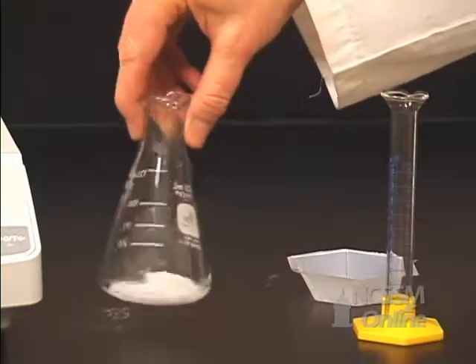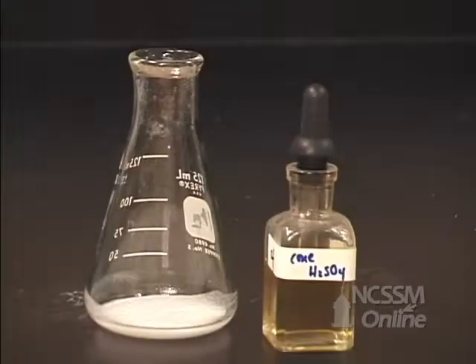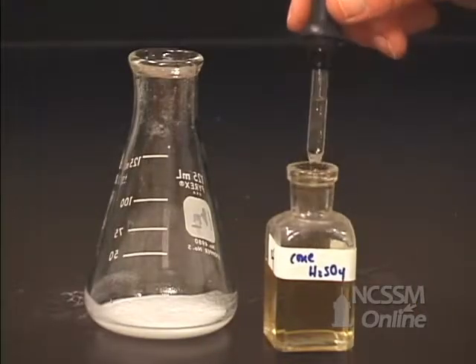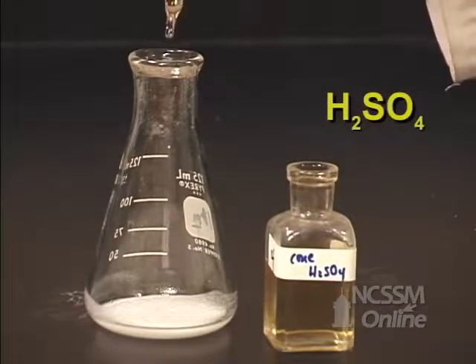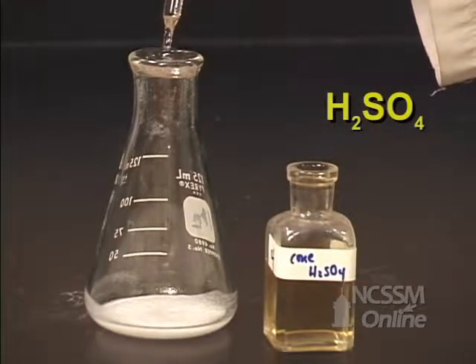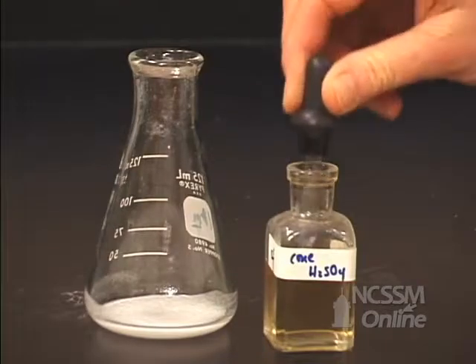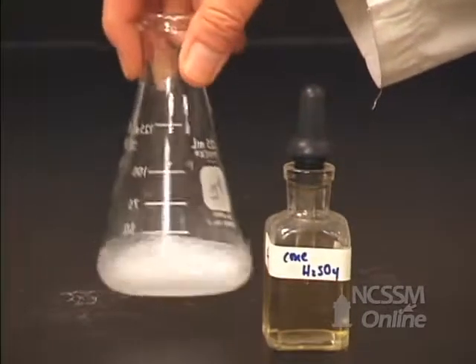And I want to mix. Next we add 5 drops of concentrated sulfuric acid. This is making us an acid environment, and it will also cause the reaction to go a little faster.